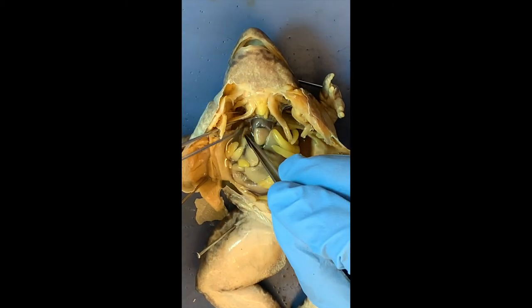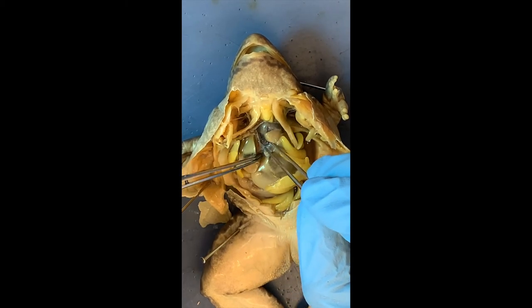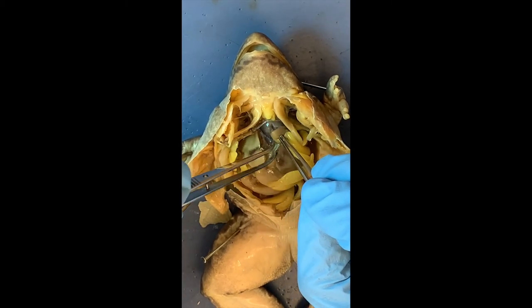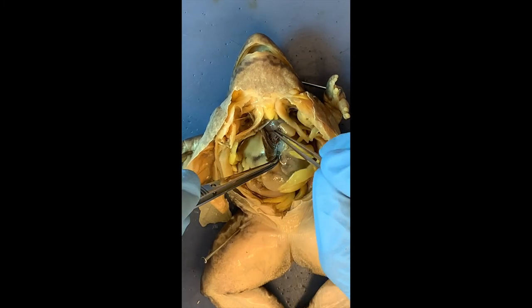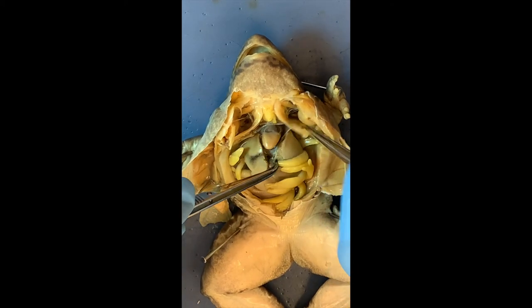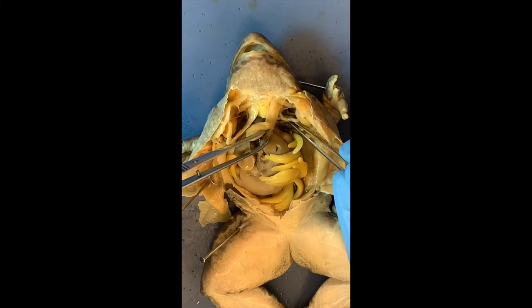Moving further down, I should see the little lungs — to show you how underdeveloped they are, and why frogs compensate with their skin to breathe. There's a lung — a very tiny structure, reddish. So that's one lung. There's the other one. Can you see it? It's spongy. So there are two small lungs, one on each side.